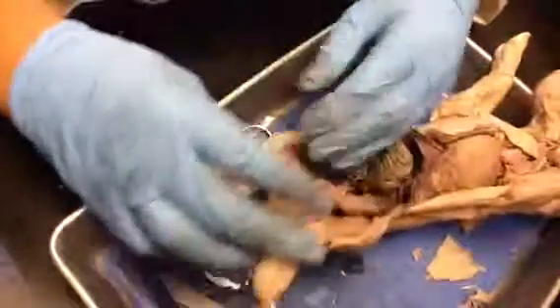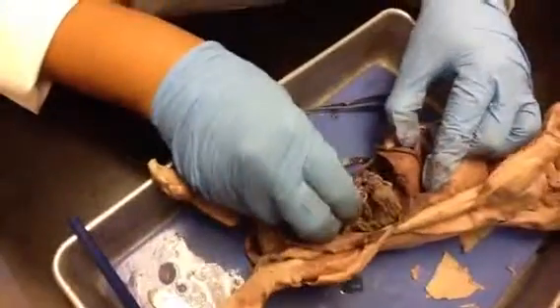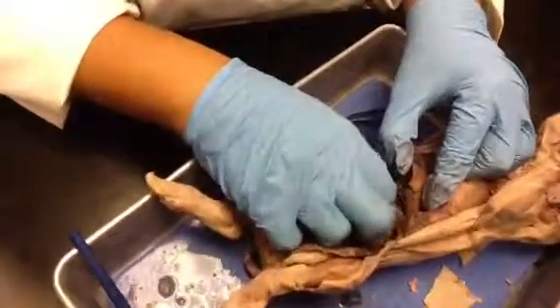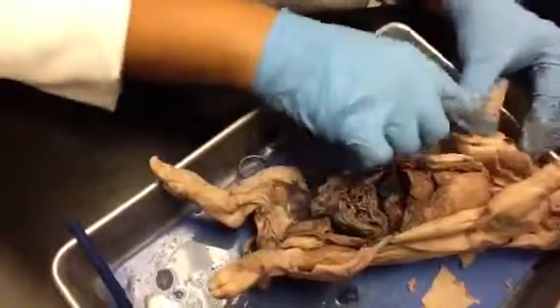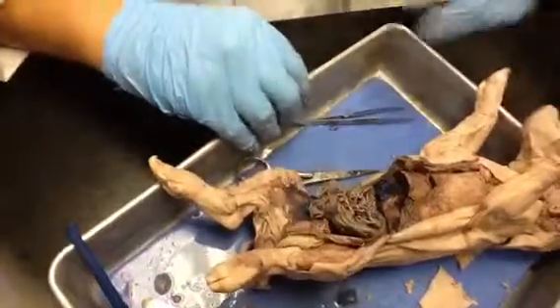So that was your digestive system, starting with the mouth. Did I miss anything? Teeth, well, the tongue. I mentioned the tongue. Yeah, I think so. Do you want me to do it on the other pig, just in case, since that one's a little dirty?